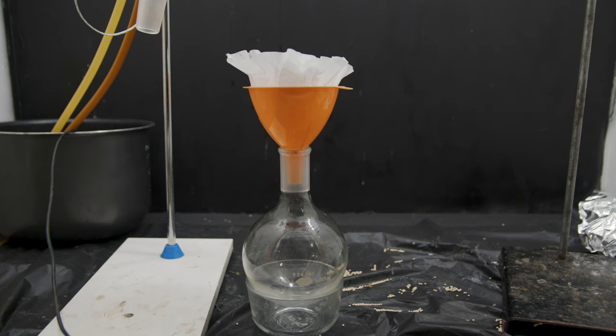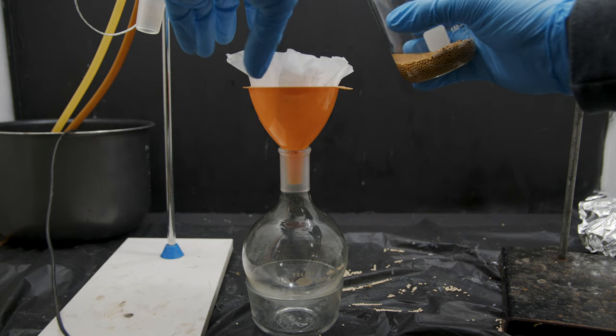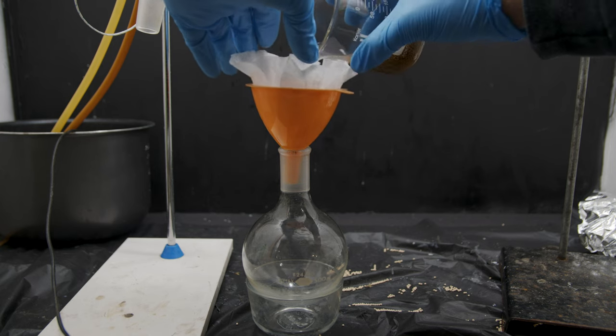So now that we have the alcohol and all these little wet sieves we can just run it through a filter to get all of the little beads off.